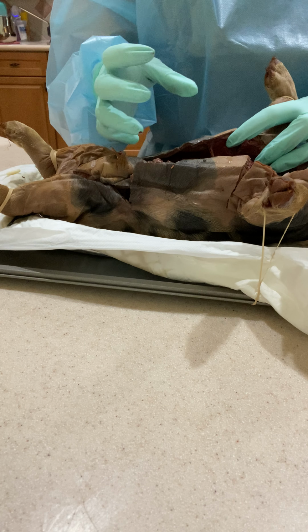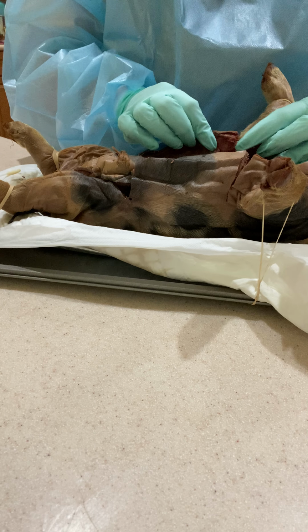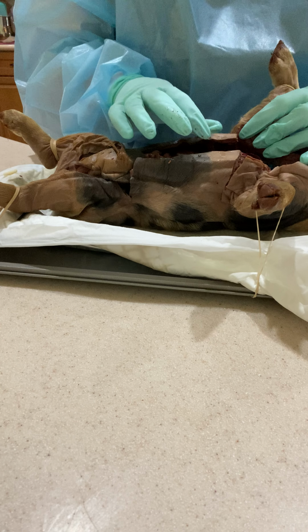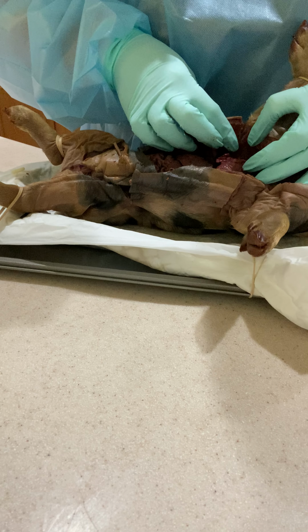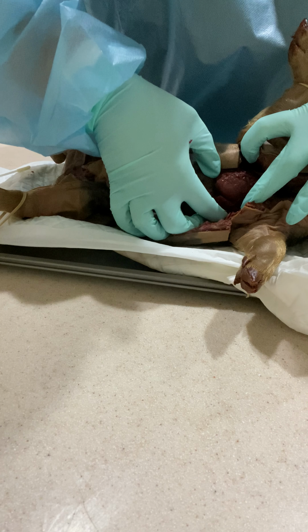For our lungs, the lungs are located around the outside of the heart. Pigs have 6 lobes, and for humans, obviously, we have 5, just to accommodate the size of our heart. You have the cranial, the medial, and the caudal. So right here is a lobe, and then you have the rest of them here and here. On this side, it's a little more mangled, but I tried to cut some back. But then you have them right here. They're on this side too.